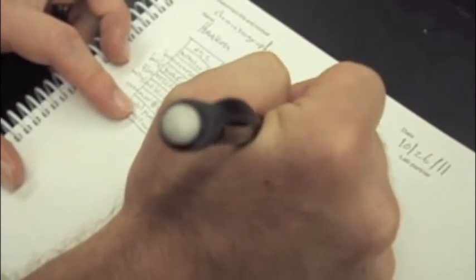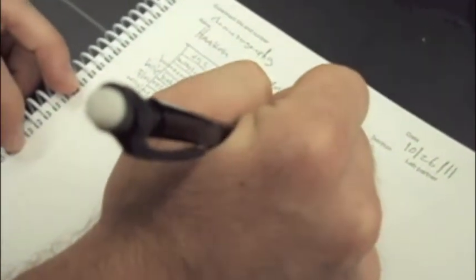Lastly, record the data by measuring how far each dye has traveled. You can now calculate the retention factor, or R sub F, which is the ratio between the distance traveled by the dye and the distance traveled by the mobile phase. When calculated, this will give you the retention factor of each of the components. The type of mobile phase used causes the difference in separation between the different plates and the different R sub F values.